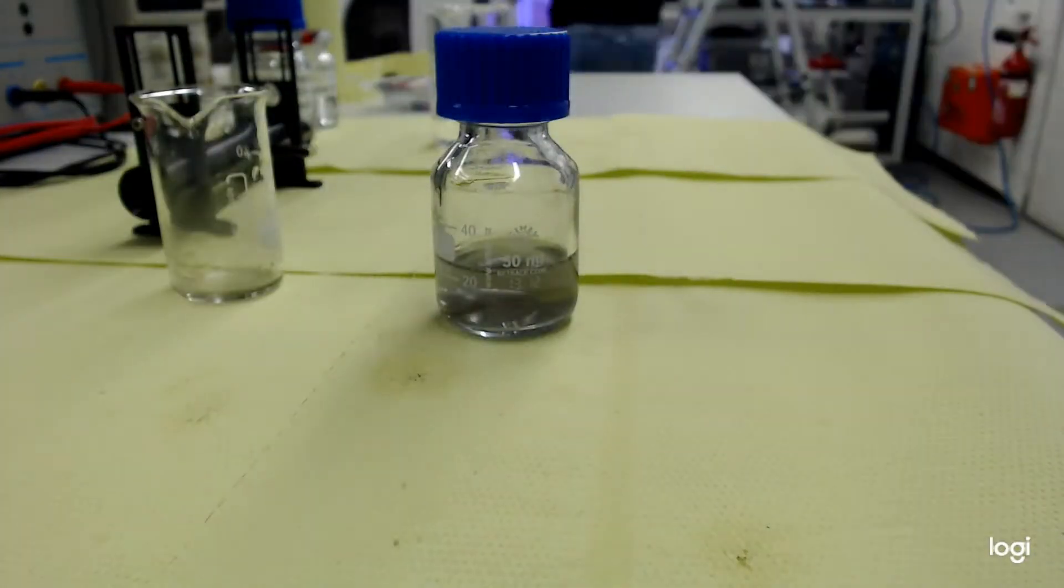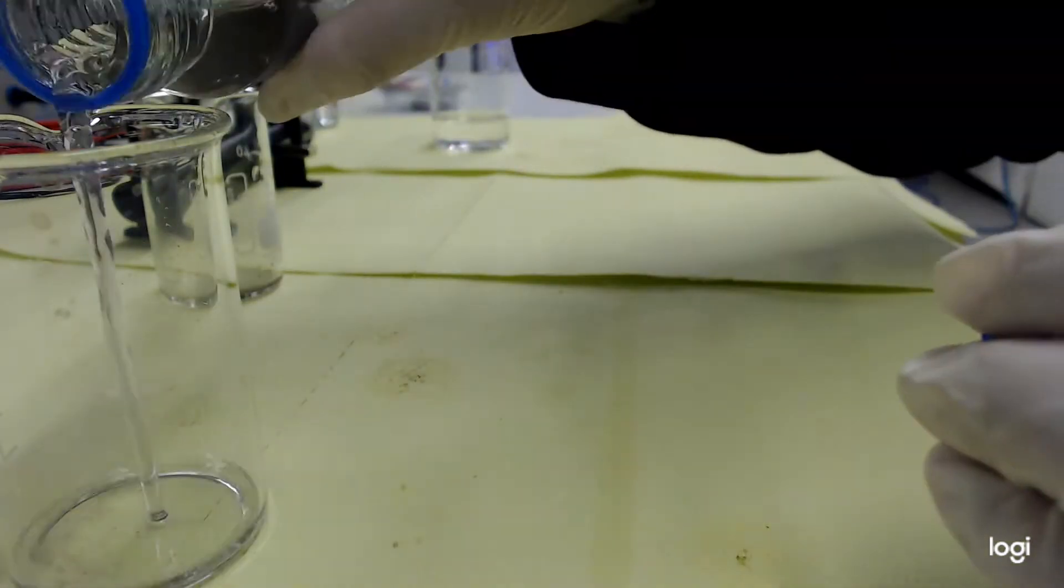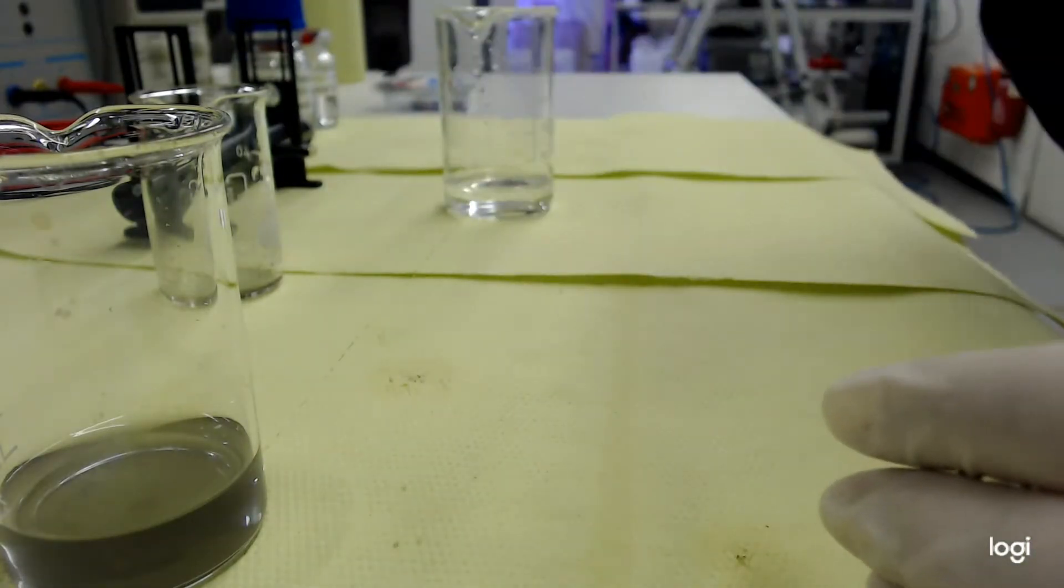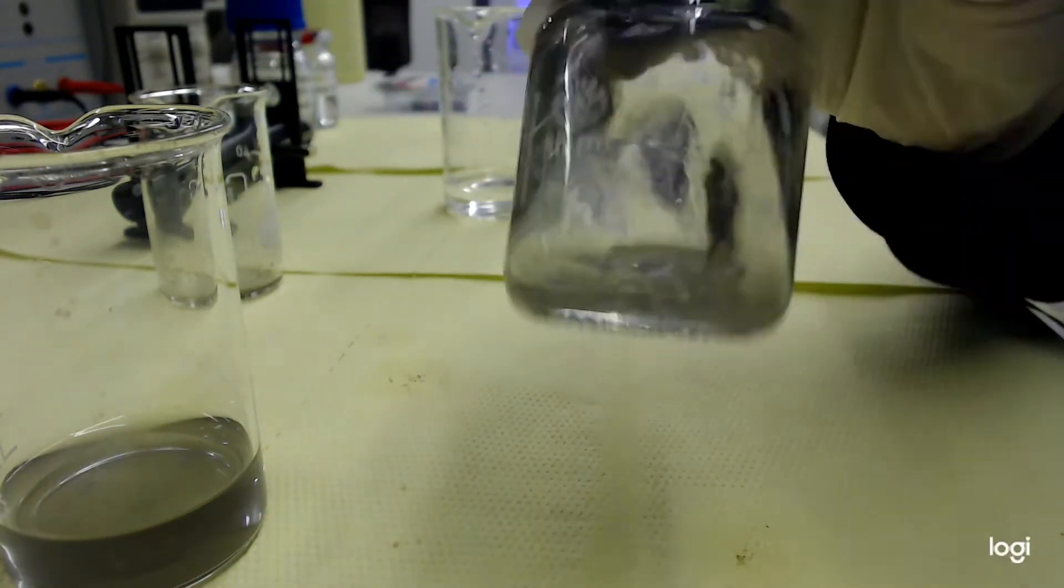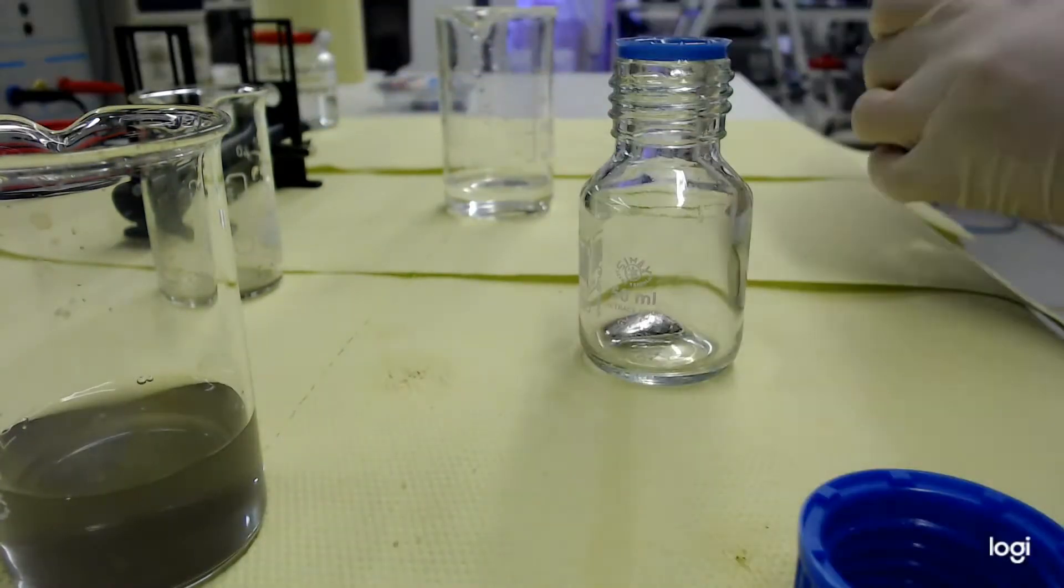After a number of successful repetitions of rinse and repeat, you have obtained your clear liquid Galinstan, which you can now test for magnetic properties.